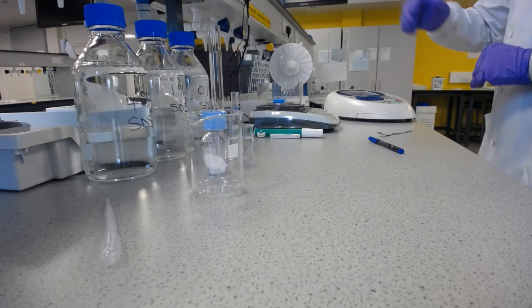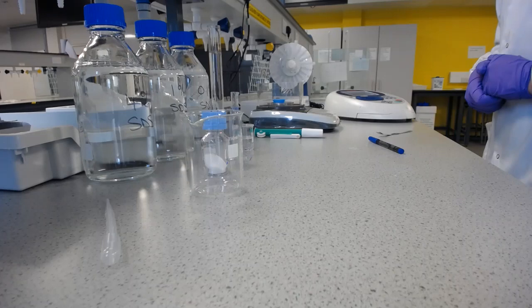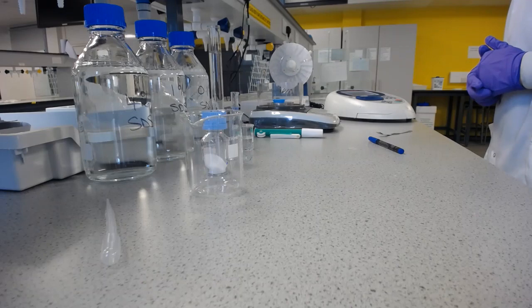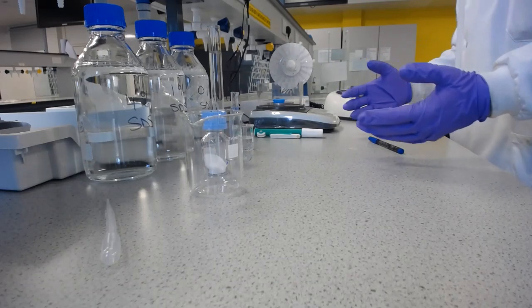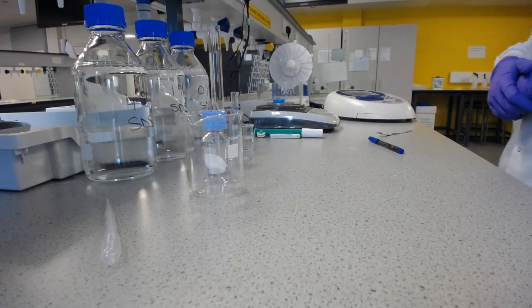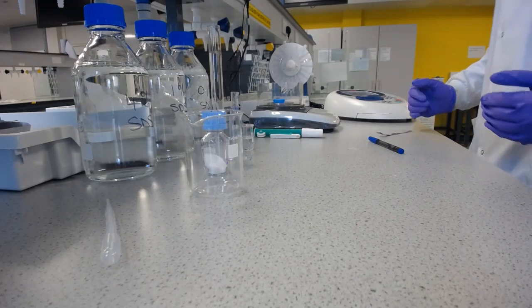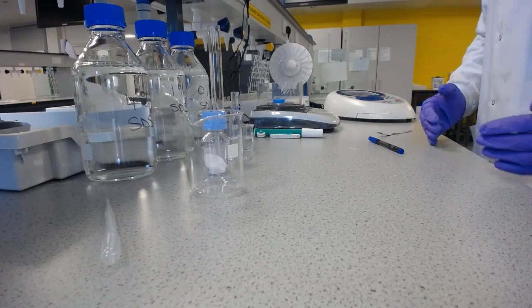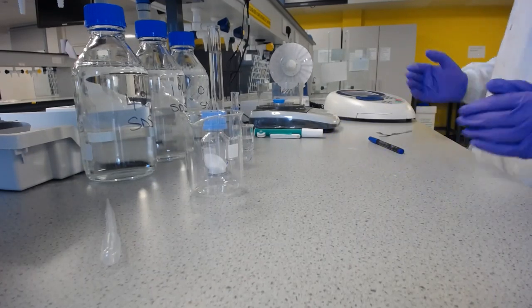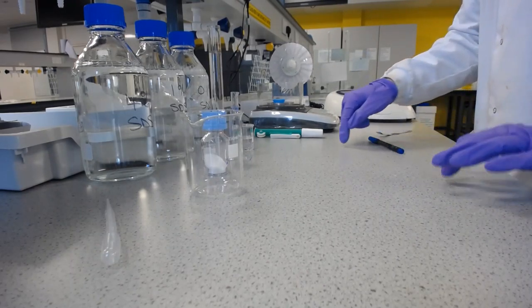So in there, we will have solutions that we will know the absorbance of once we've taken the absorbance reading. And we need to know what concentration does that correspond to. So what we'll do is the reverse. We'll make multiple concentrations of aspirin solution, known concentrations, that we don't know the absorbance of, take their absorbance, and then note them down. And then we can plot those with the concentration on the x-axis that we know because we've made them up, and the absorbance that we know because we've tested it in the spectrophotometer on the y-axis, and plot our results.